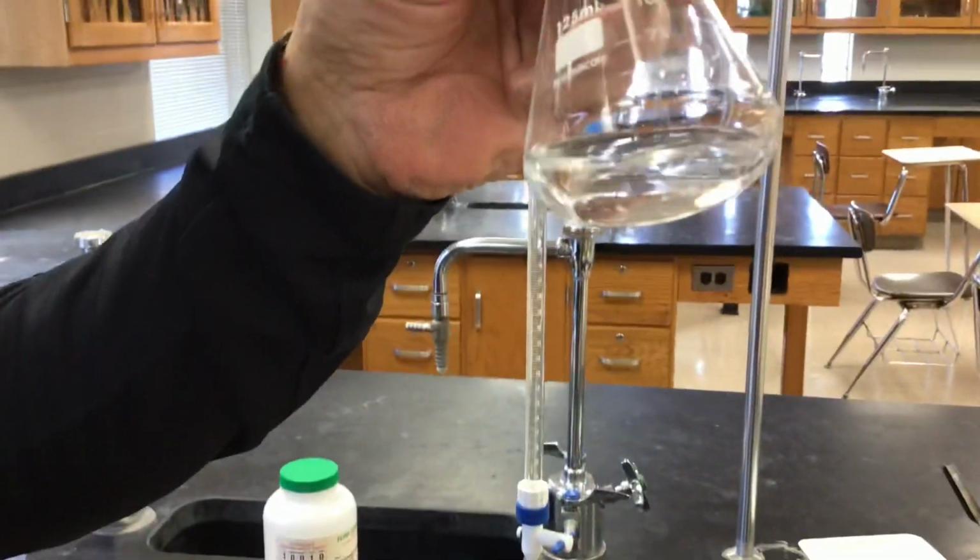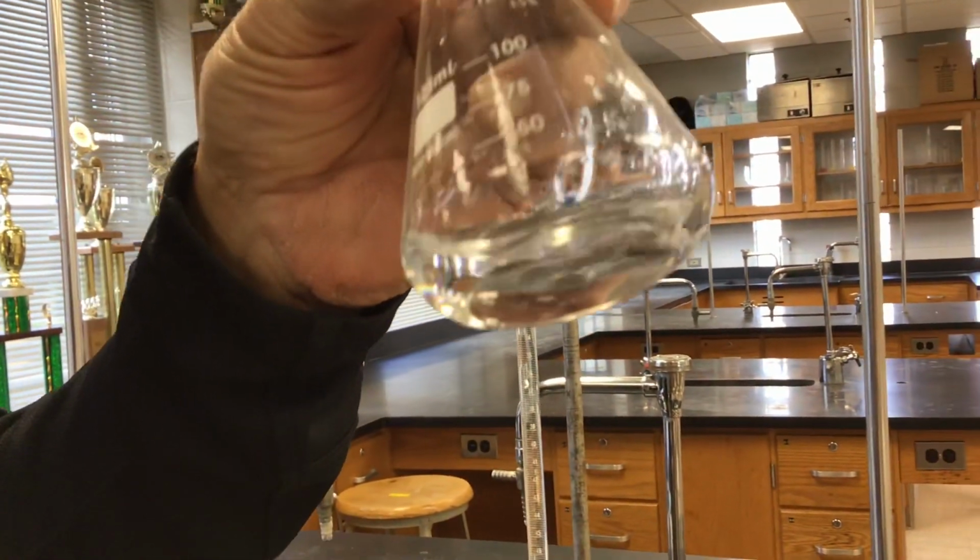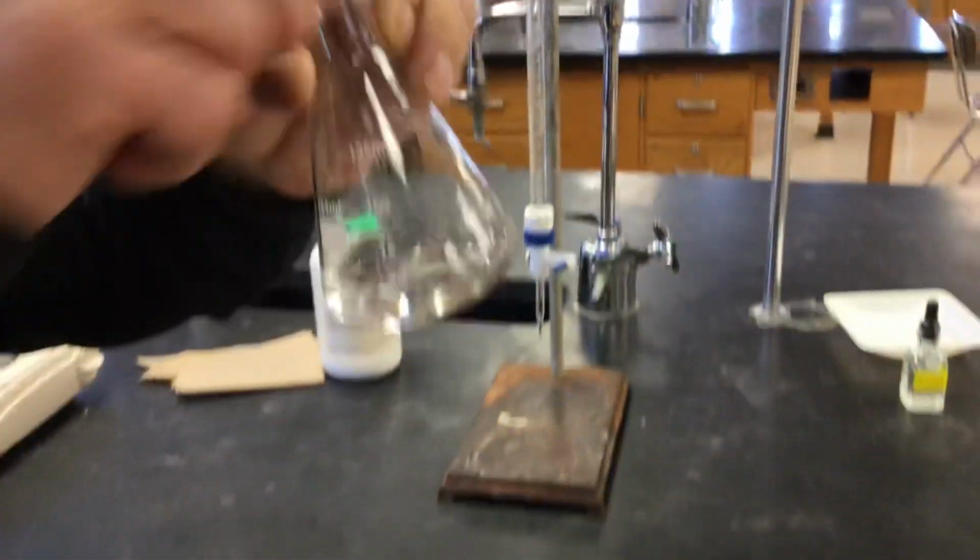I don't know, Mr. Moore, must be dissolved by now, just based on the amount of time that we took. Anybody see any in there? I'd have to put my glasses on to know for sure. Okay, we'll save you that trouble. It's dissolved.